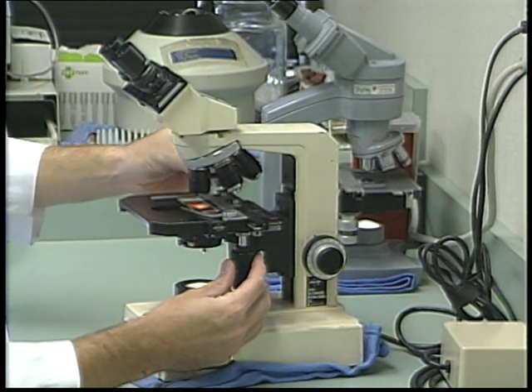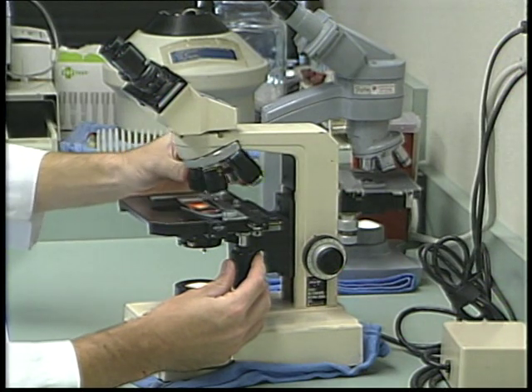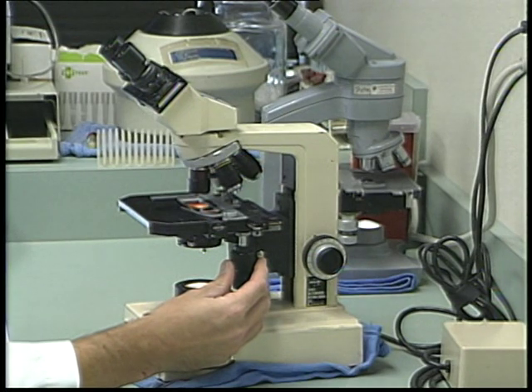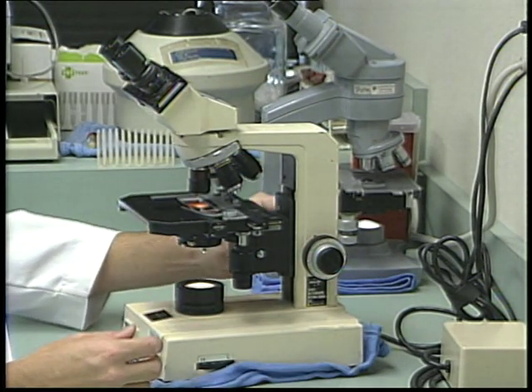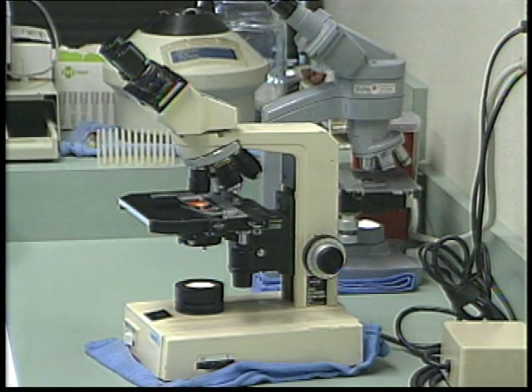Most microscopes are equipped with 3 or 4 objectives, or lenses. These lenses determine the magnification. The objectives range from 4x to 100x magnification. When looking for parasite eggs, you will generally start out scanning the slide with a 4 to 10x objective in place.